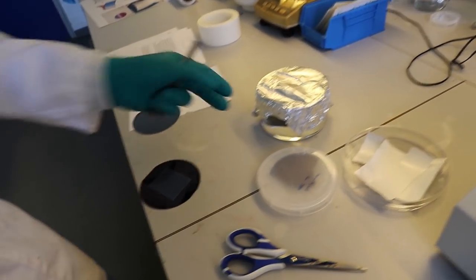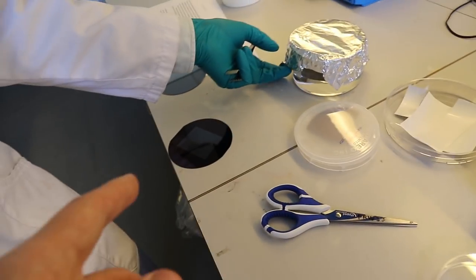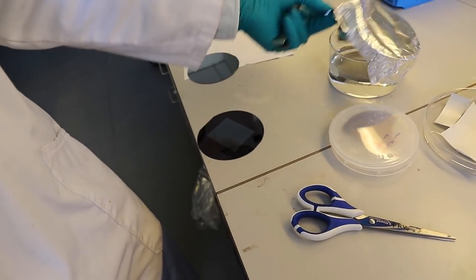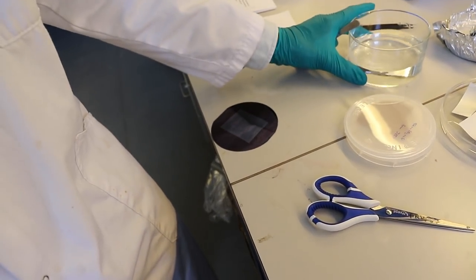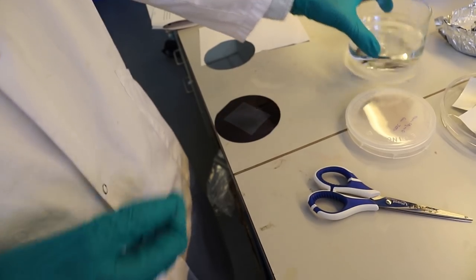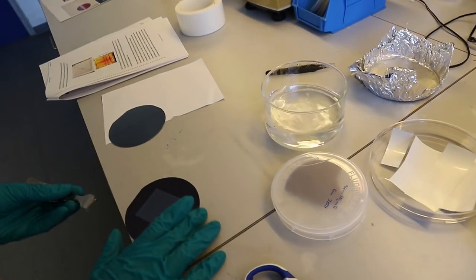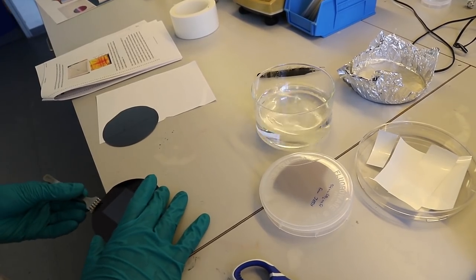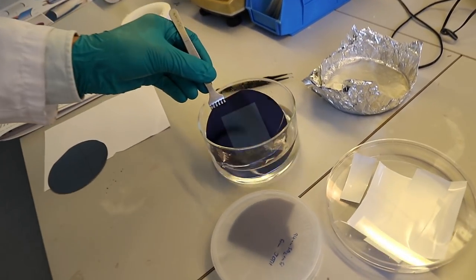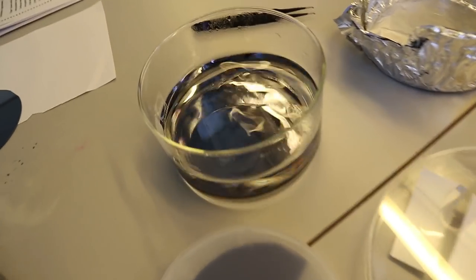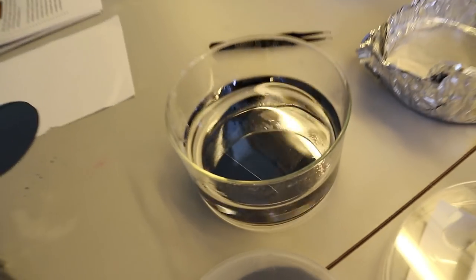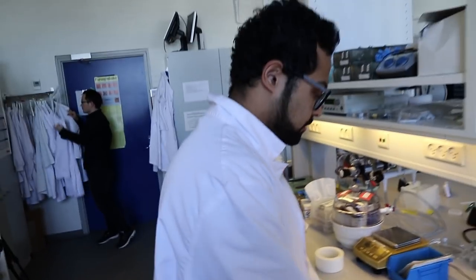I like to keep it overnight because that makes sure the PVA has come off completely. But if you reduce the PVA foil thickness, you can... Be careful it doesn't slide to the floor. All right, now we leave it overnight. We'll come back tomorrow to see how it goes.